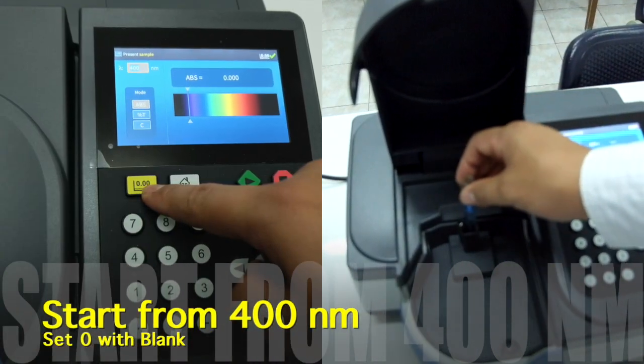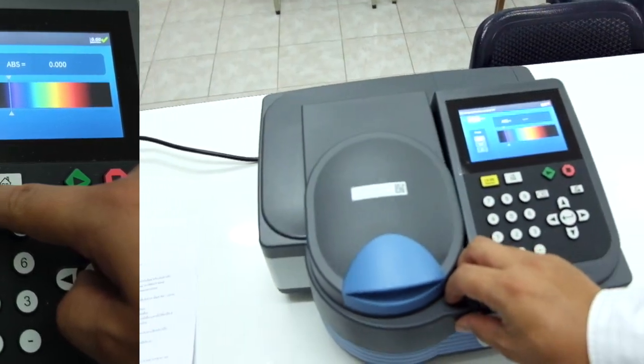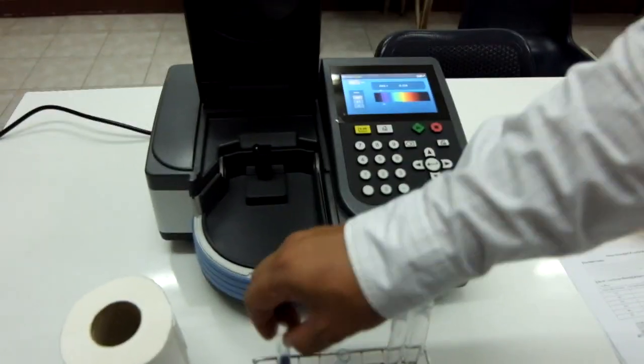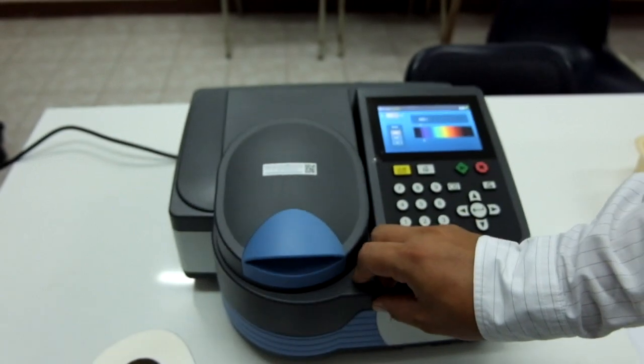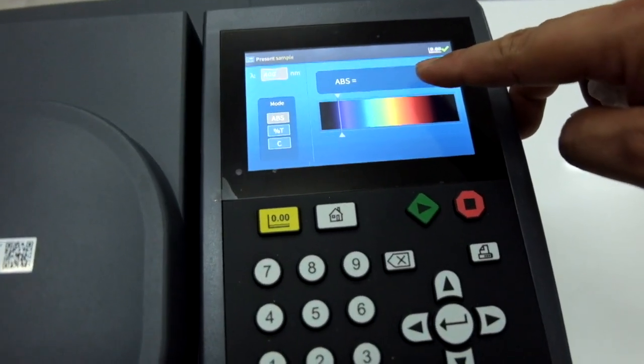At 400 nanometers, you place the blank tube for setting 0. Once 0, change to the lambda max cuvette. Read the absorbance value shown and record it.